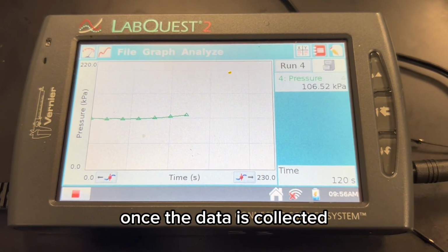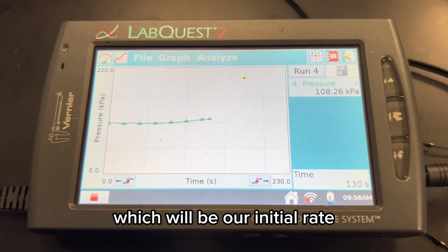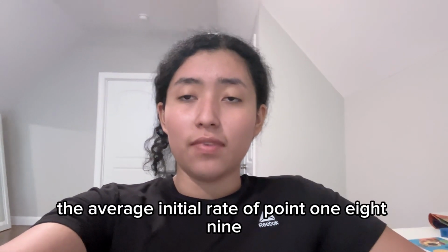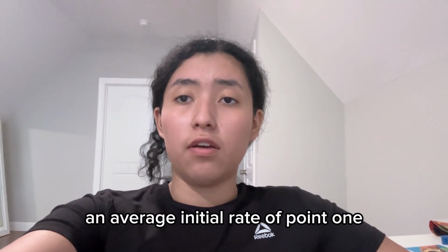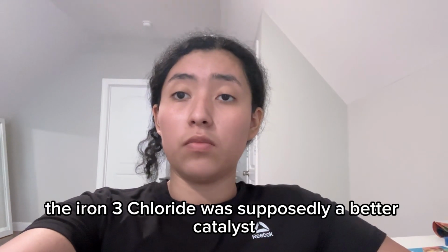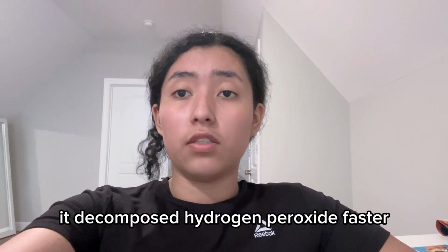Once the data collection is complete, we will find the linear region of the graph and find the highest slope, which will be our initial rate. The result for the experiment just done was an average initial rate of 0.189. The experiment with potassium iodide as a catalyst had an average initial rate of 0.138. As you can see, the iron 3 chloride was supposedly a better catalyst since it has a bigger number for the initial rate, meaning it decomposed the hydrogen peroxide faster.